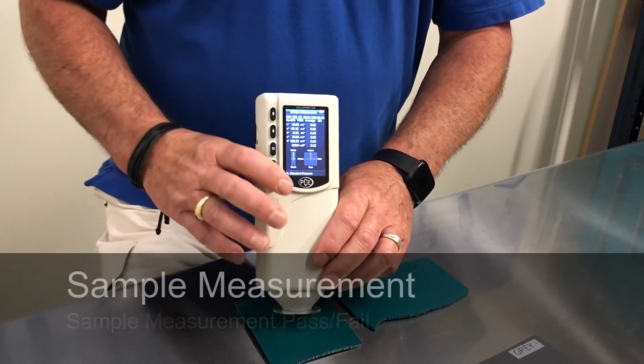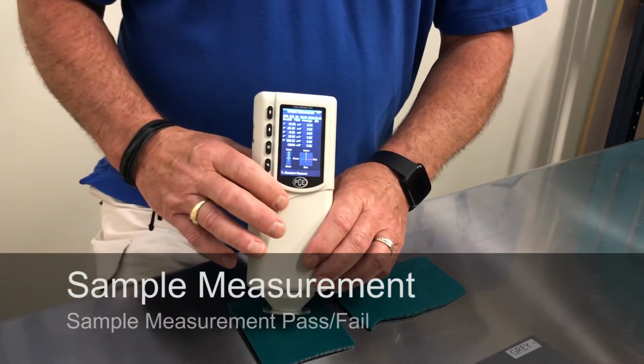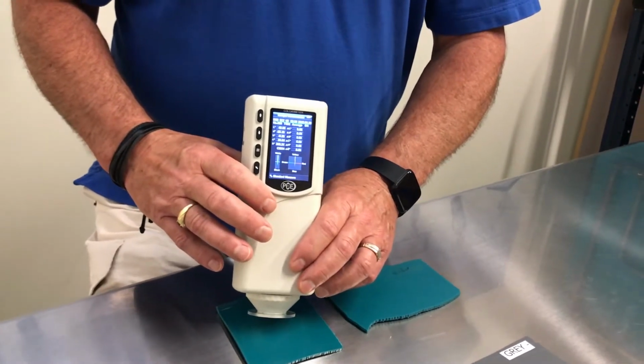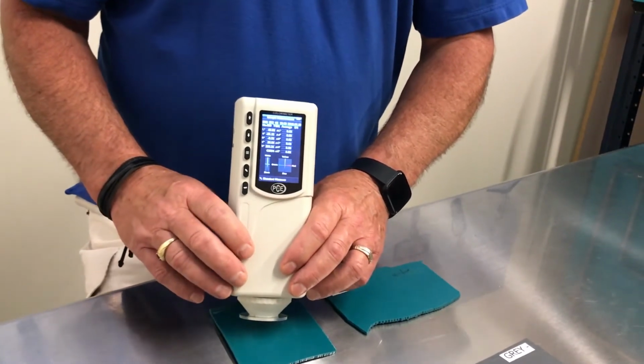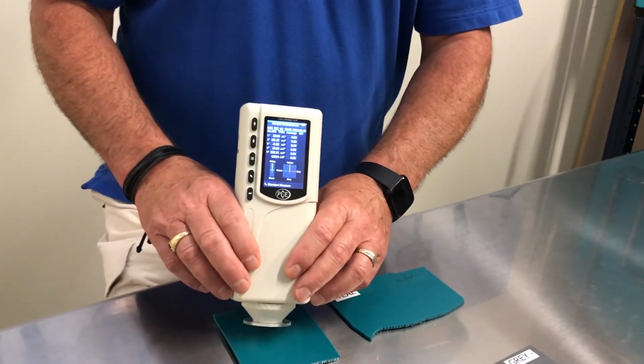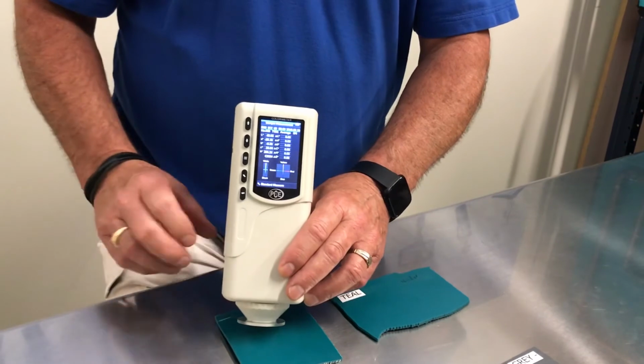The screen splits on the meter. On the left side you'll see the standard measurement color, and on the right side is ready for the sample to be shot 4 times with the color meter to obtain the average of the sample to be compared against the standard color.